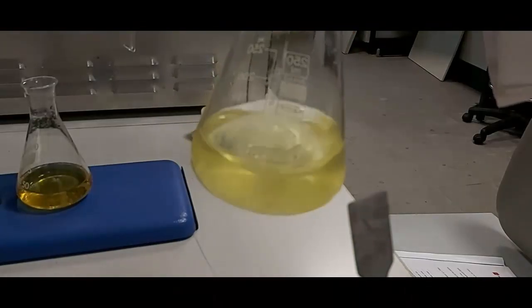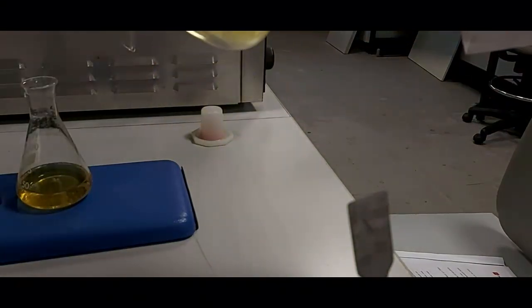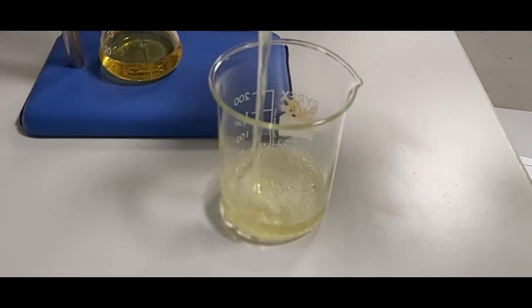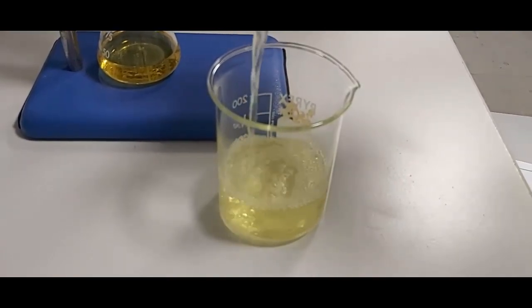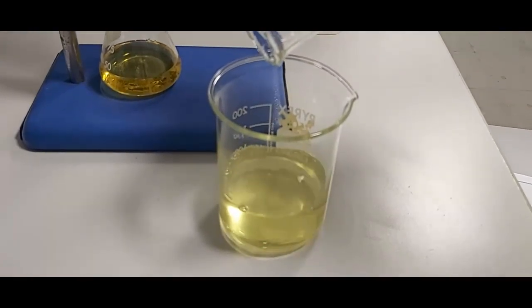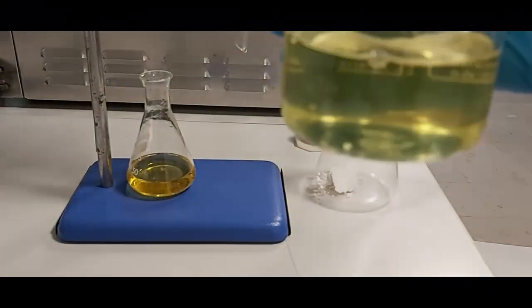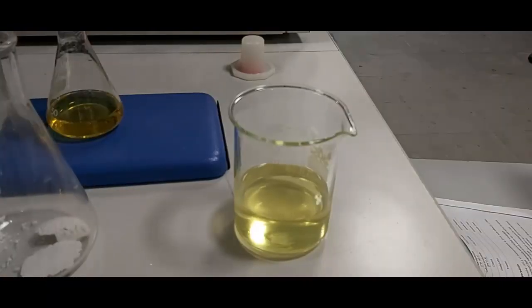You will see the solution becomes very clear. We then perform filtration to remove the MgSO4. After filtration, I have my product dissolved in the ether solution. The next step is to do TLC analysis.